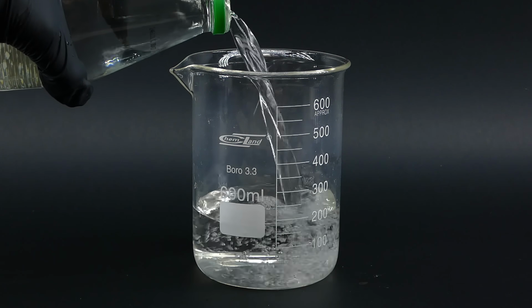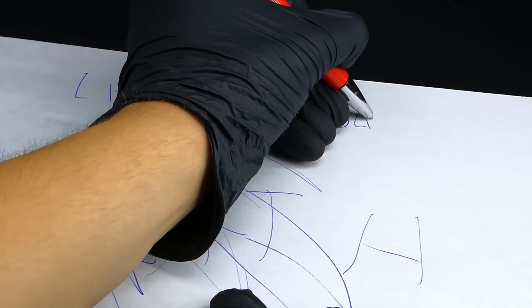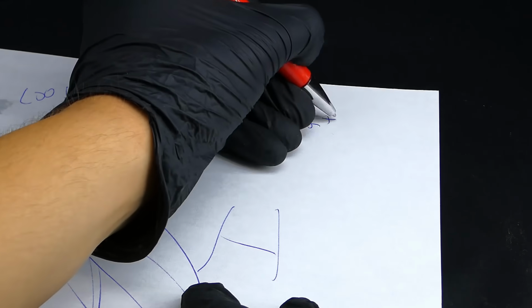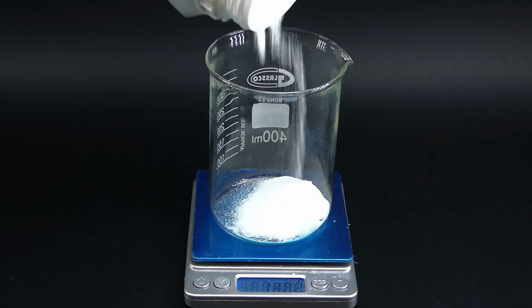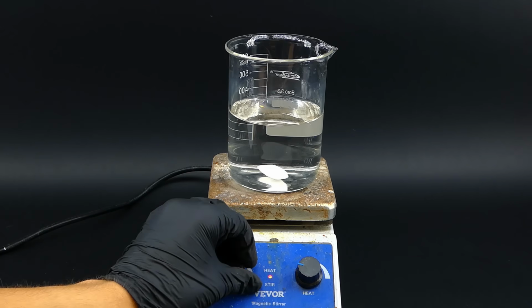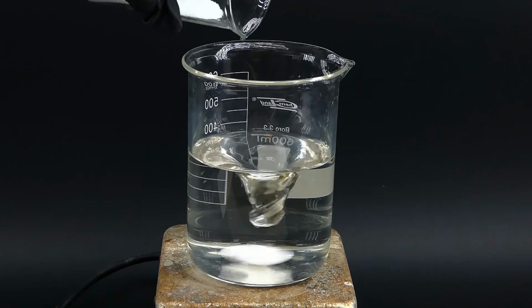which corresponds to about 350 milliliters. I then ran some advanced mathematical calculations on how much baking soda I have to add, and after figuring everything out, I know that I have to use 53 grams of it. I weighed it using my scale, and to start adding it to the vinegar, I turned on strong stirring and proceeded to add the baking soda very slowly.